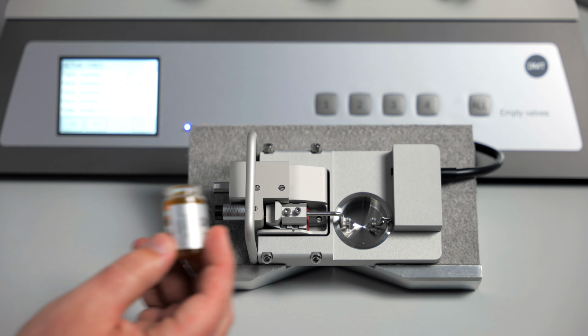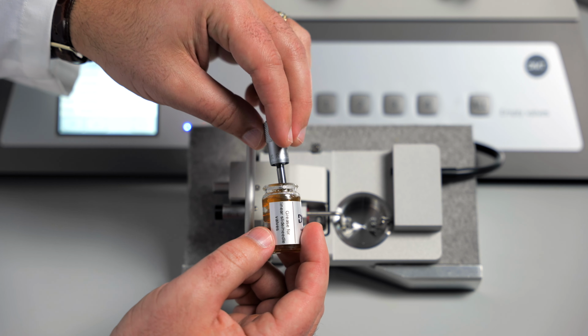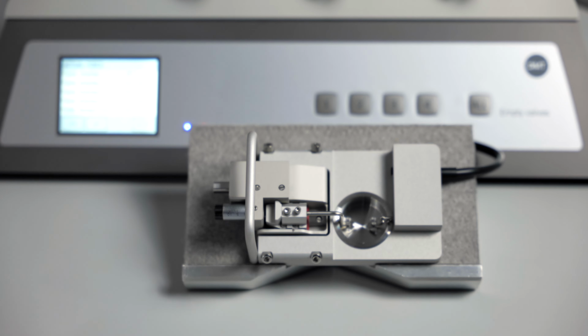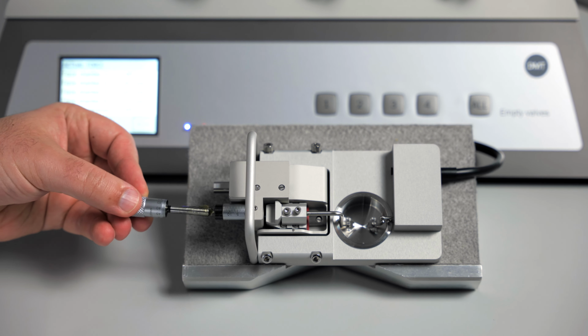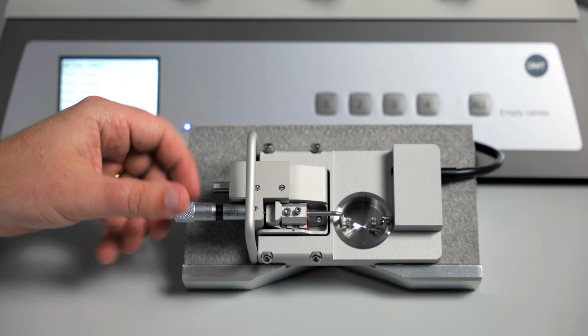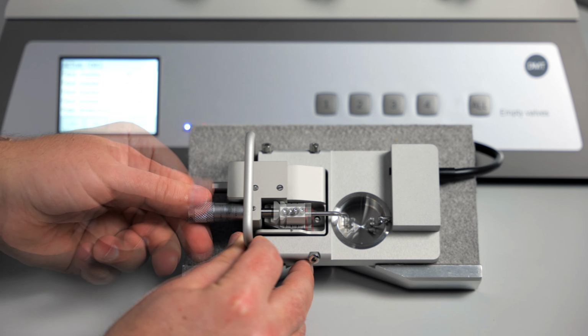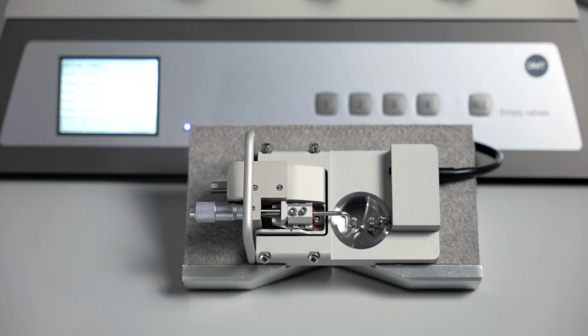You can stick the post of the micropositioner directly into the brown grease. Get a generous amount of grease on the post and then reattach the micropositioner. Screw it in until you see the attached mount moving in the chamber. This will re-grease the linear slide.